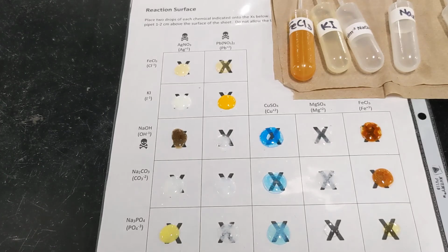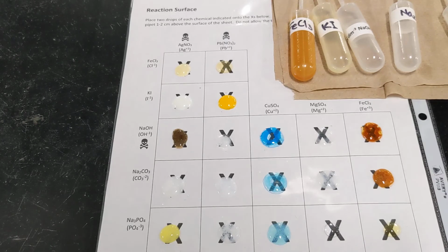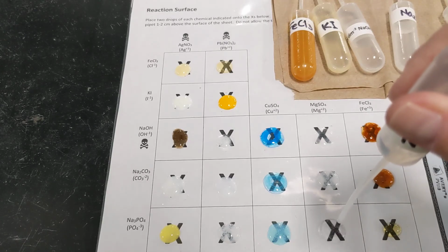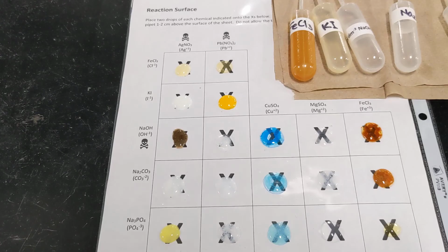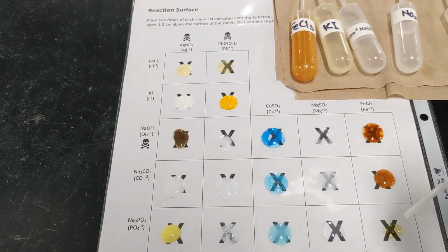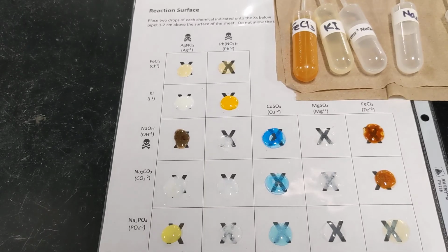Okay, and in box 3 with the copper 2 sulfate, another precipitate. This time it looks like it's a very light blue precipitate. Okay, box 4, that one does not appear to have a precipitate at this point. We'll give it a few minutes just to be sure. And box 5. Okay, yep, that's a precipitate as well. And that's kind of hard to tell. Maybe a very light brown color, maybe a tan precipitate is what you could call it.